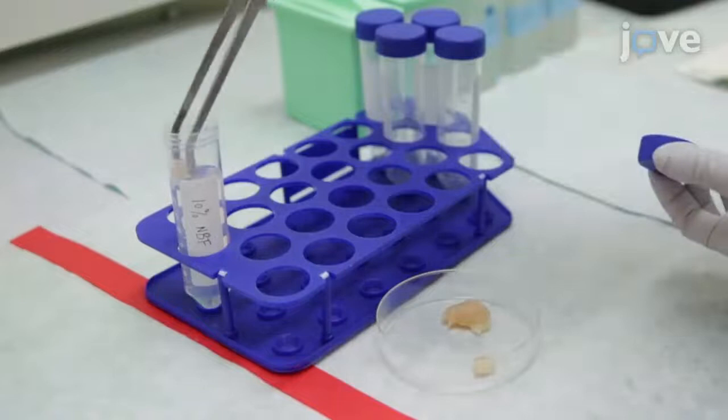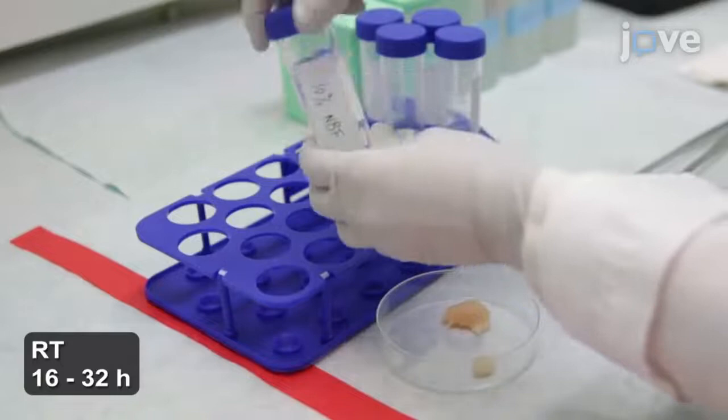To prepare the tissue, fix it immediately following dissection in 10% neutral buffered formalin at room temperature for 16 to 32 hours.